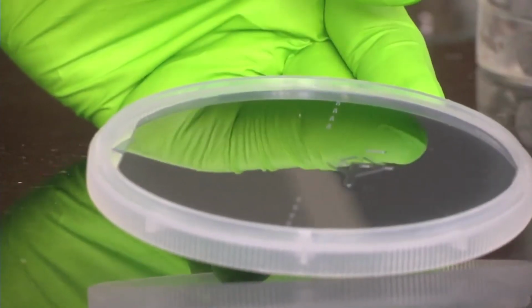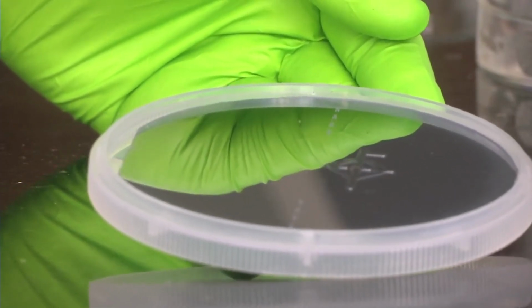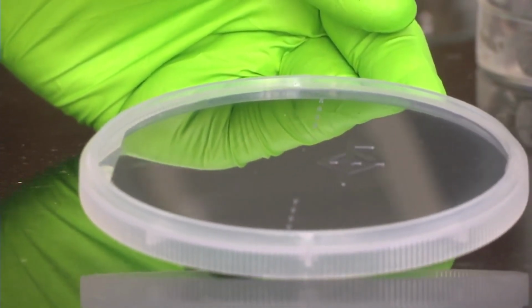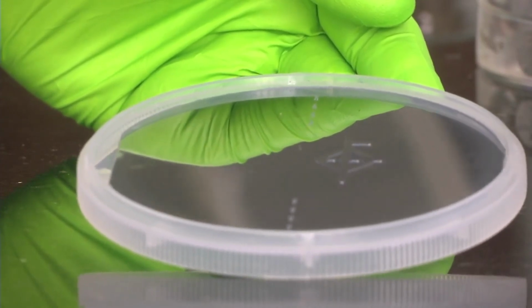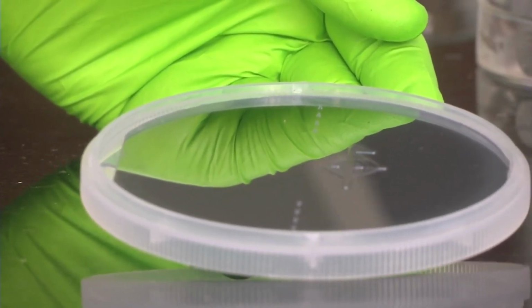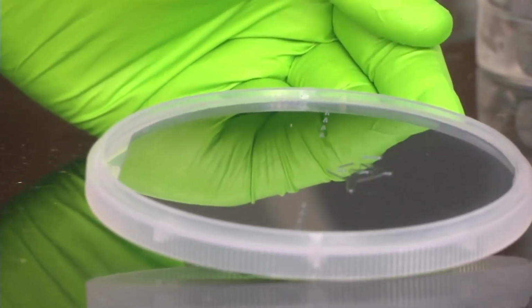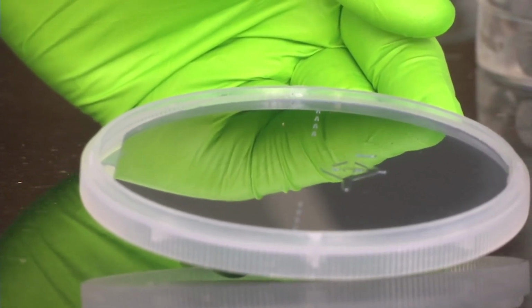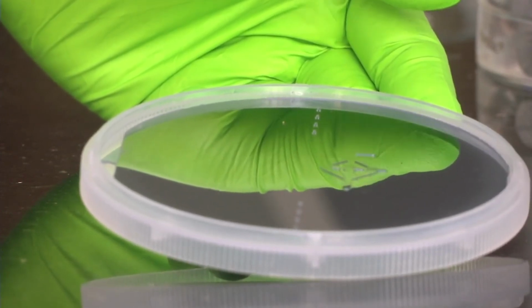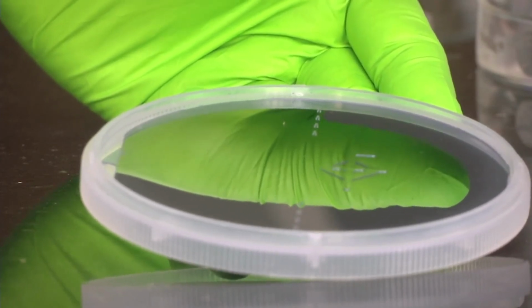As we said, we take a silicon wafer, around 500 microns in thickness. Then we have an oxide layer on top. Then we do photolithography and pattern the surface of the wafer so that we get this pattern. Then we remove the photoresist after developing it, and the pattern is formed on the surface of the wafer. Then we do something called deep reactive ion etching. Wherever the pattern is not supposed to be there, we etch away the silicon material, so that only the pattern remains as an embossed structure on top.